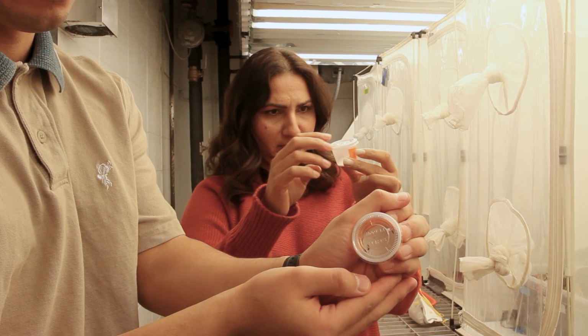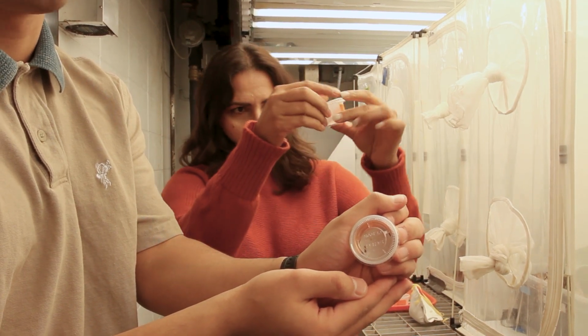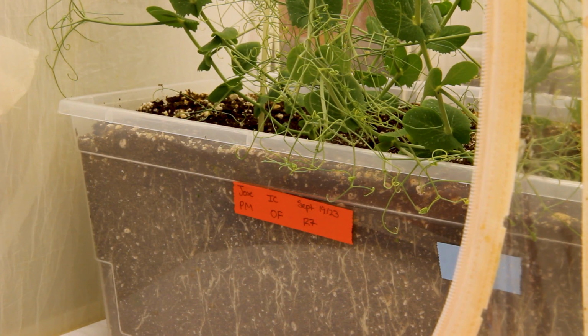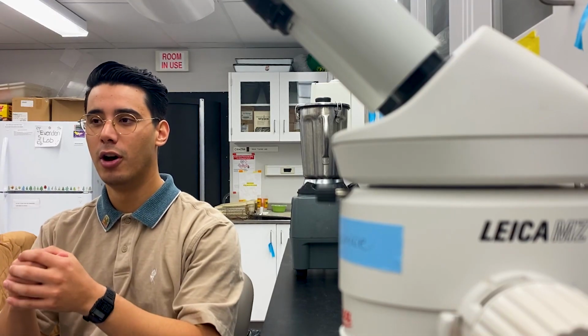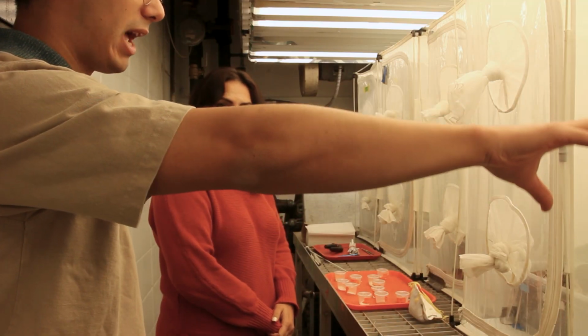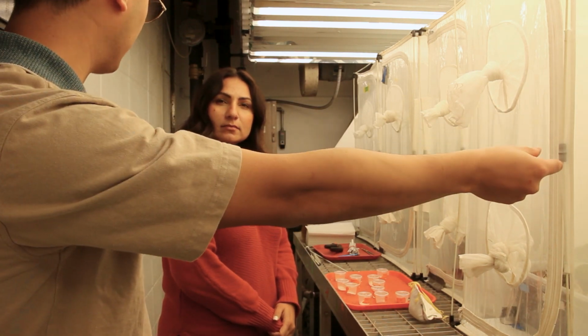So once we pull the pupae, we put them in little containers, we weigh them, we wait for them to emerge, and once they emerge, we can freeze and kill the adults, and then also get characteristics from those adults. So the weight, the sex, the length, and the wing area are all very important characteristics of these adults. So removing the pupae from the plant is really important because we're able to then essentially put a little collar on these larvae and identify which pupae the adult is coming from. So then we can tie the pupal weights to the adult weights and adult characteristics.